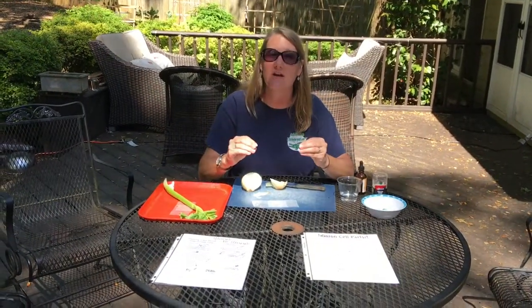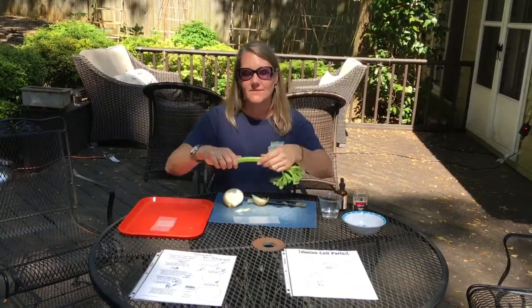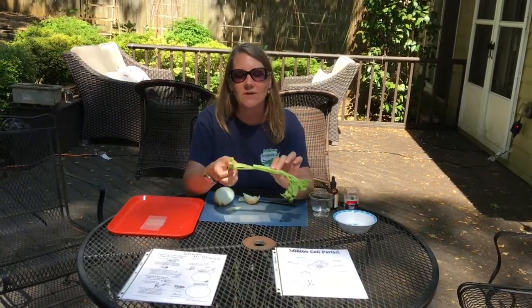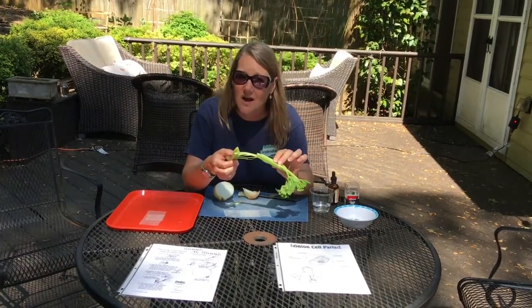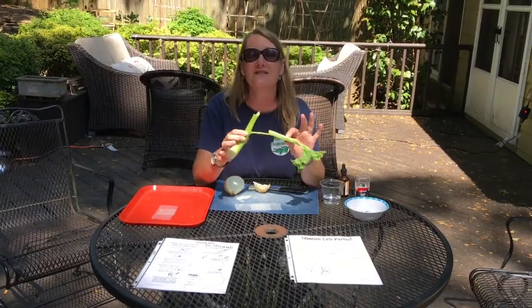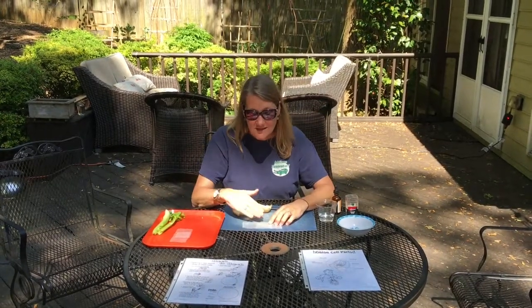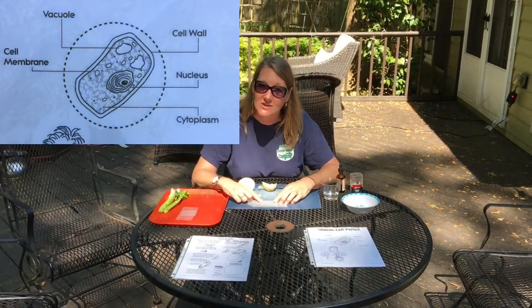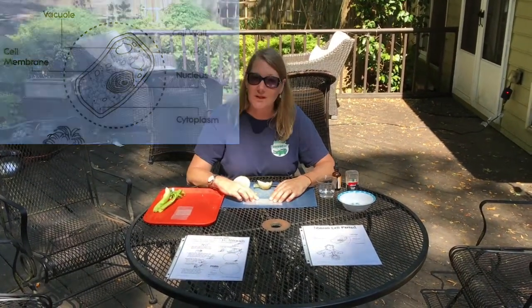The main thing we noticed between the onion skin and the animal cell was that the onion skin had a cell wall — it looked like a bunch of bricks stacked on top of each other. The cell wall provides support for the plant, such as in celery. If you break celery you can see all of the cellulose, which is not digestible to us, but that's what makes up the cell wall and gives the cell its shape. In the plant cell we could see the main differences: the cell wall, that big vacuole in the middle that stores water, and chloroplasts.